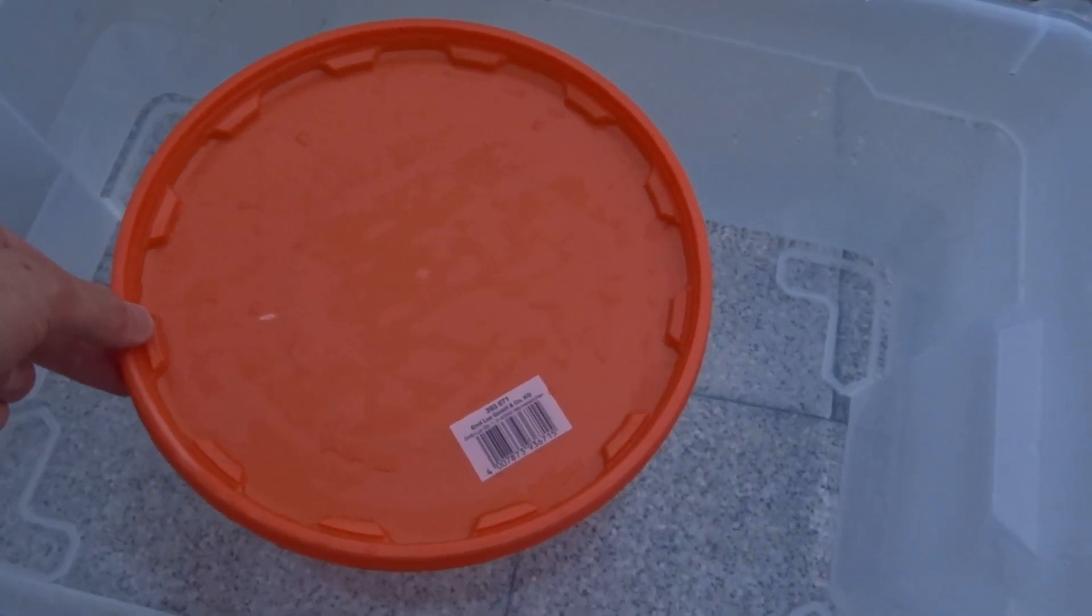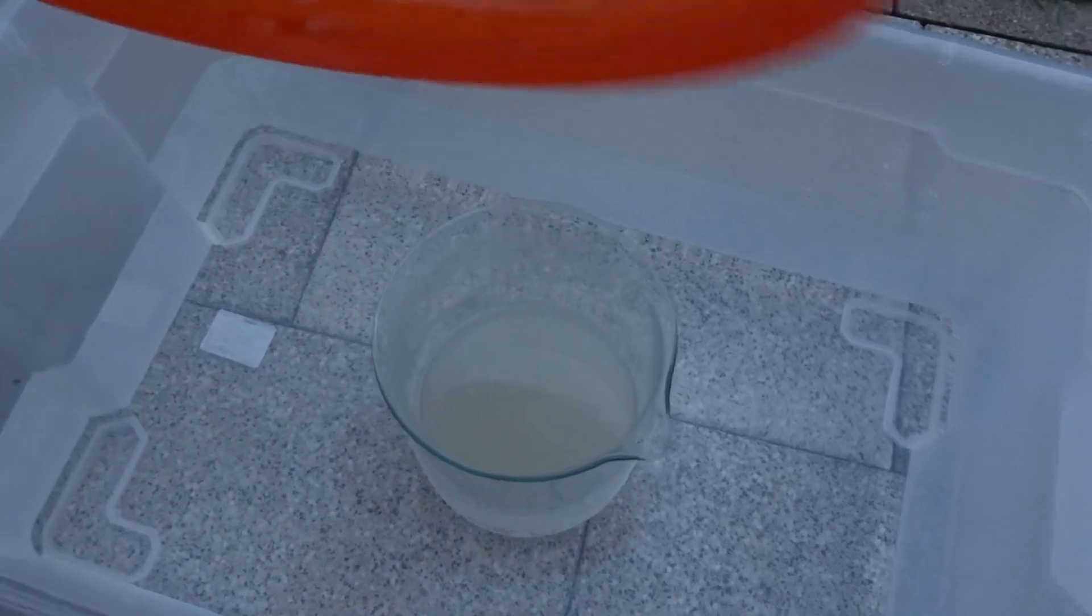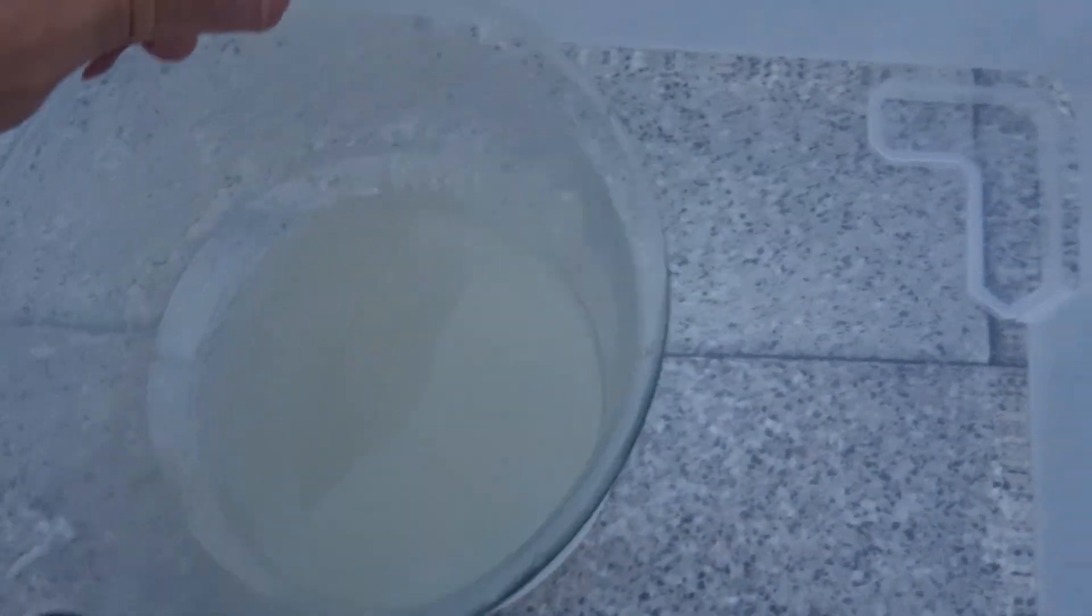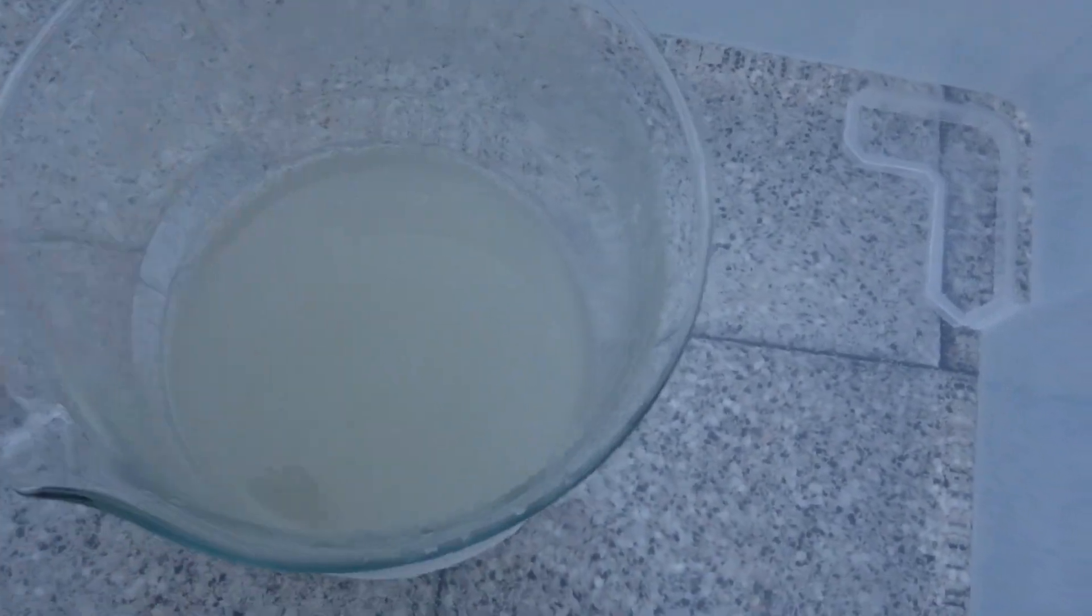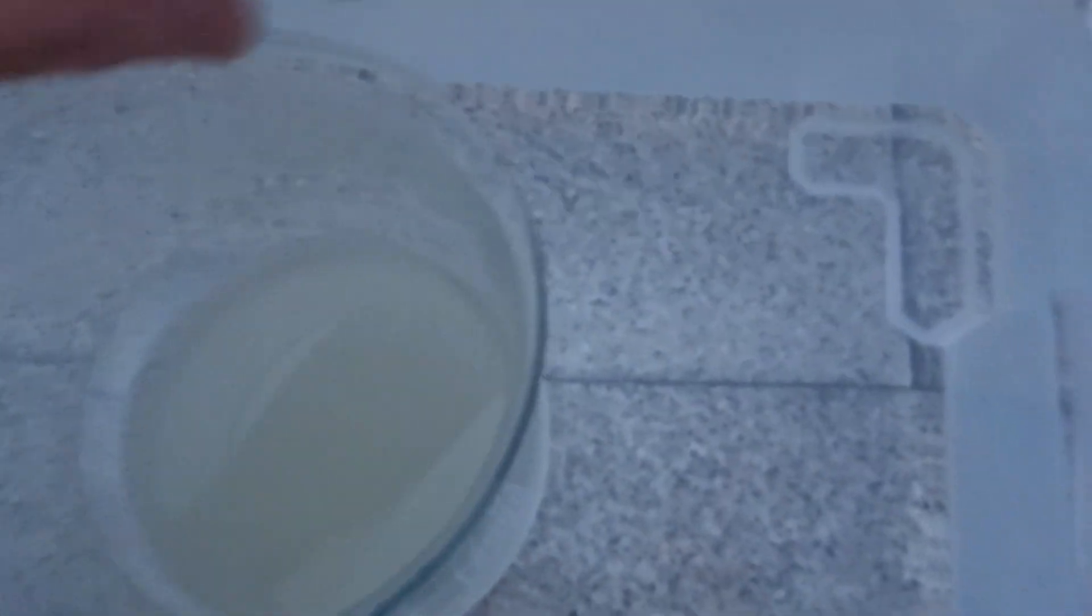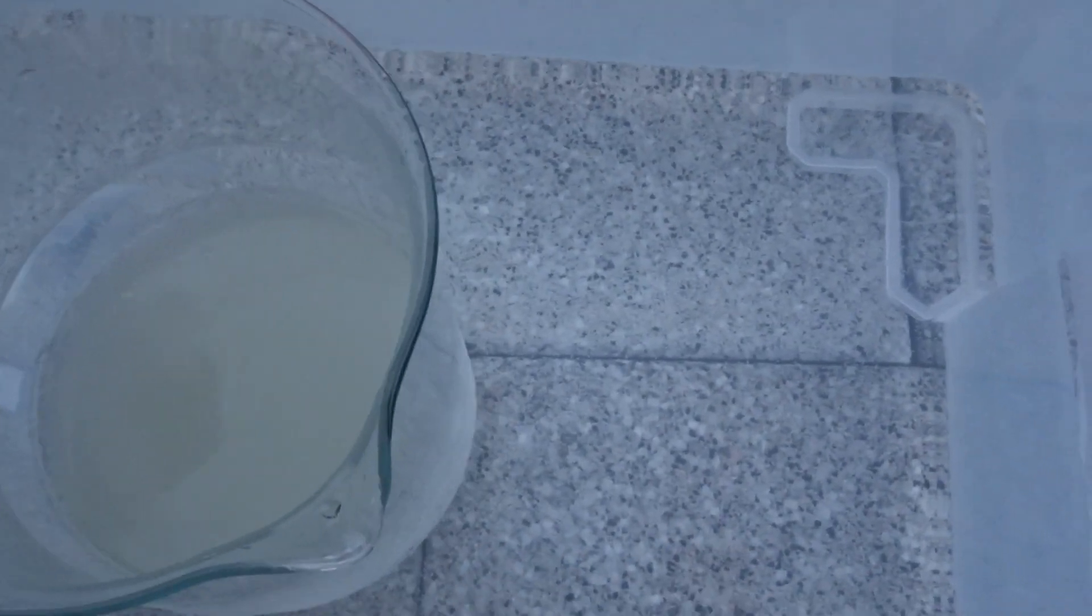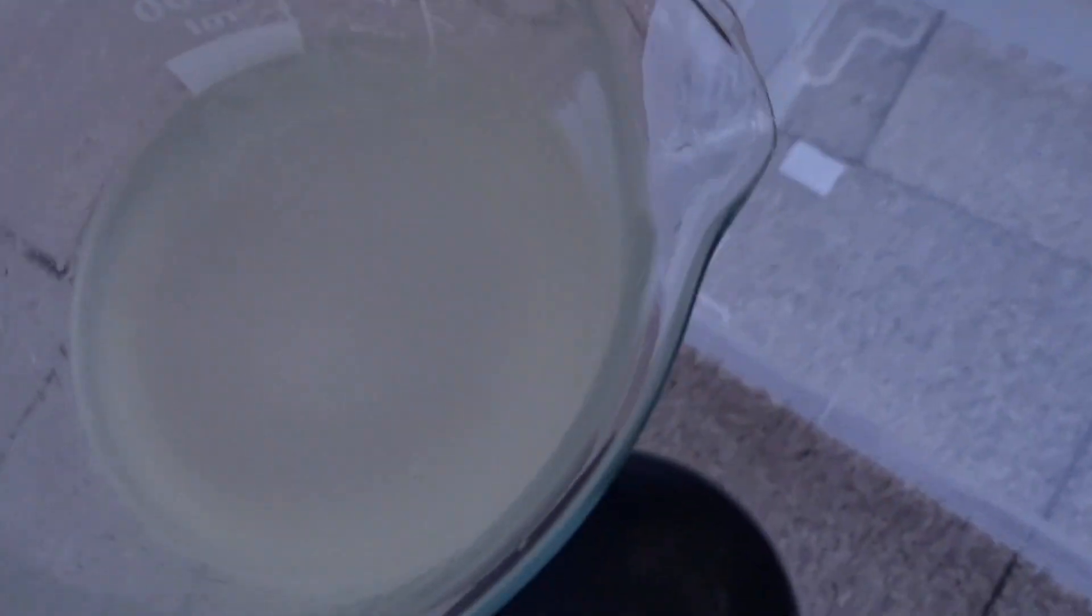Now it's finally time to take a look at what we got. Little to no chloroform here. We see that a little bit of acetone polymer is making this yellow. Of course, it was colorless just a few seconds ago. Let's take a look at what we got. Nice. That's what I call a chloroform layer. So the only thing left now is decanting this.